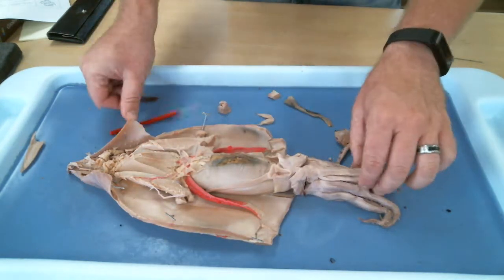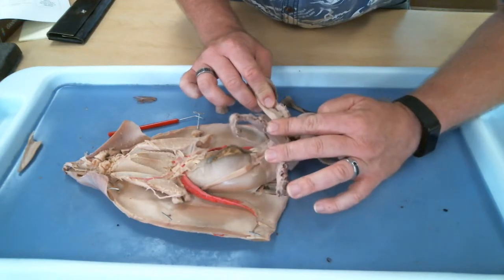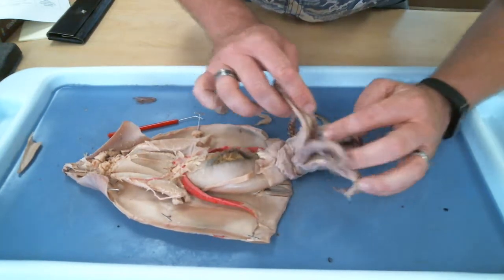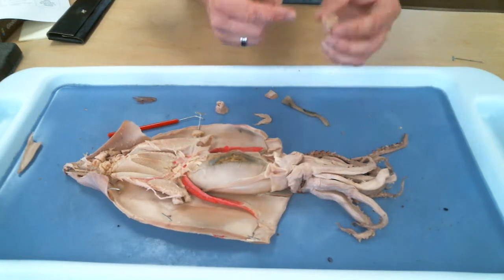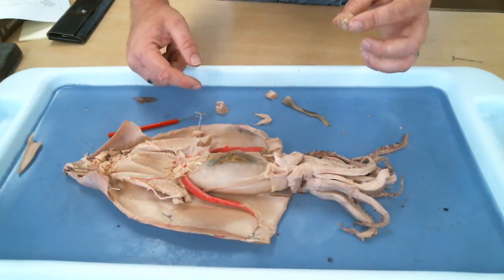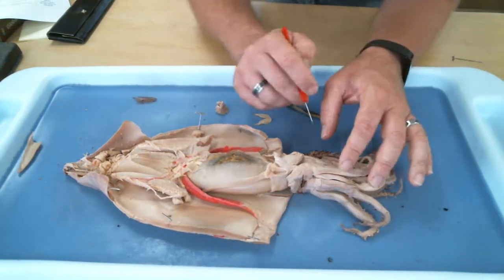There's a tube. I don't know if I can get it on the video. There is a tube that was attached to the back of the buccal bulb. I can't see it on this particular specimen. But what's the name of the tube that would have left out the back of the mouth? Not the anus. Yeah, that would be a really short digestive system. Mouth, butt. No. There's a tube called the esophagus, right? Same thing that we found in the worm. So the esophagus leads back.